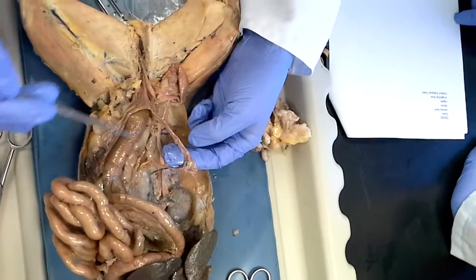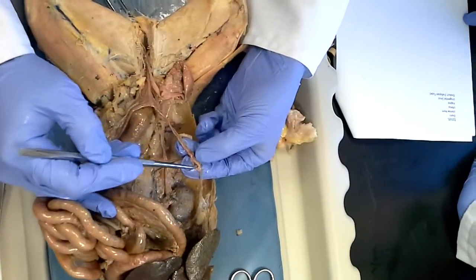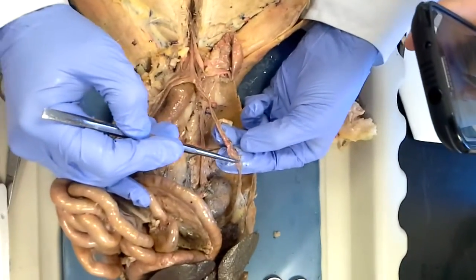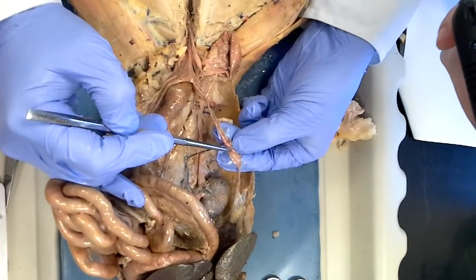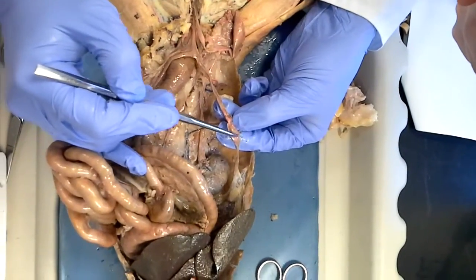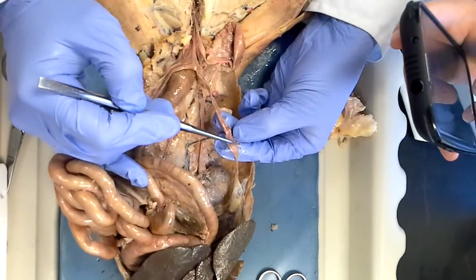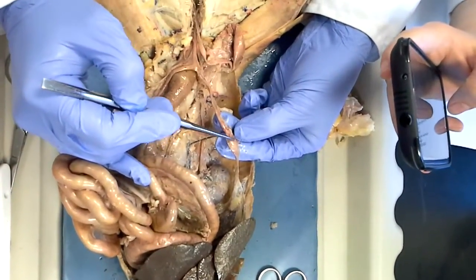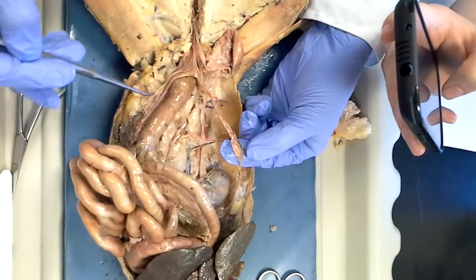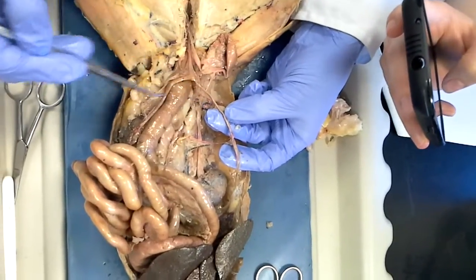The uterus itself is Y-shaped. What we see here, that little tiny thing, is the ovary. Then there's a little tube around the ovary, and that can be called the oviduct — that's the non-human name. In humans we call them fallopian tubes or uterine tubes. So that is the ovary, and then the oviduct.